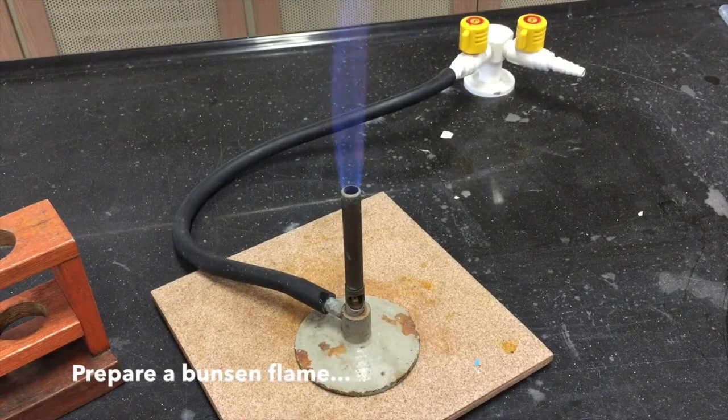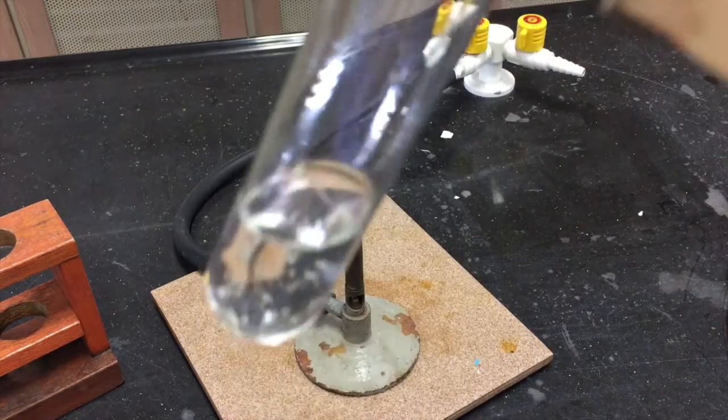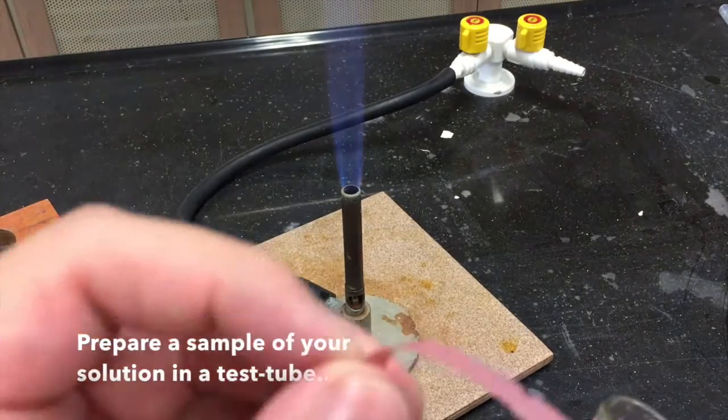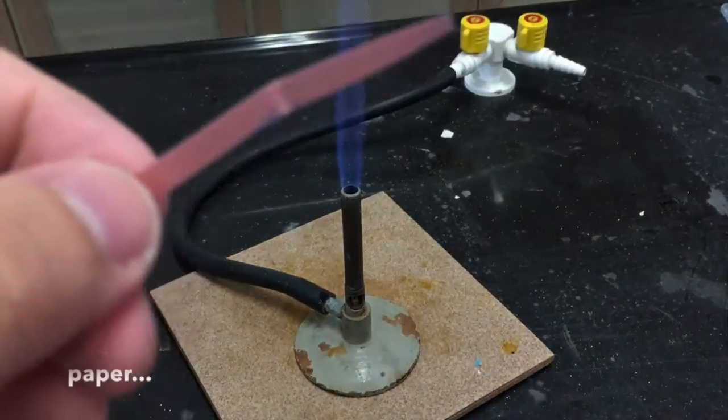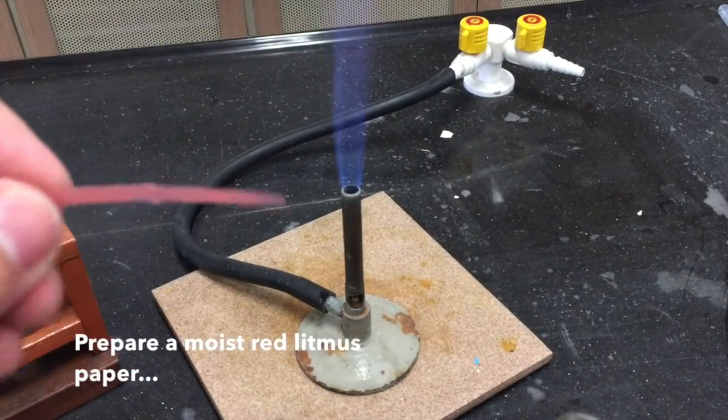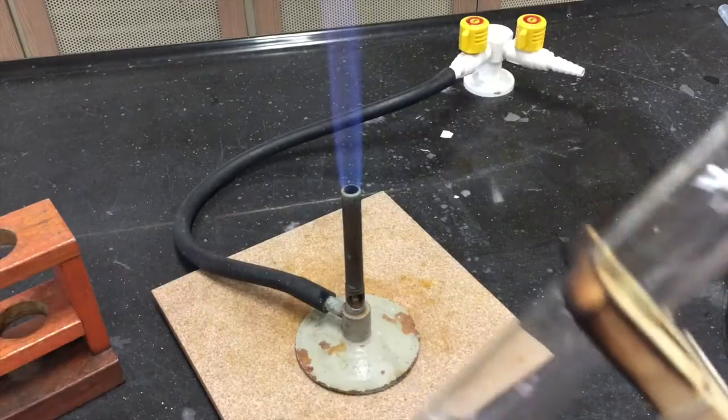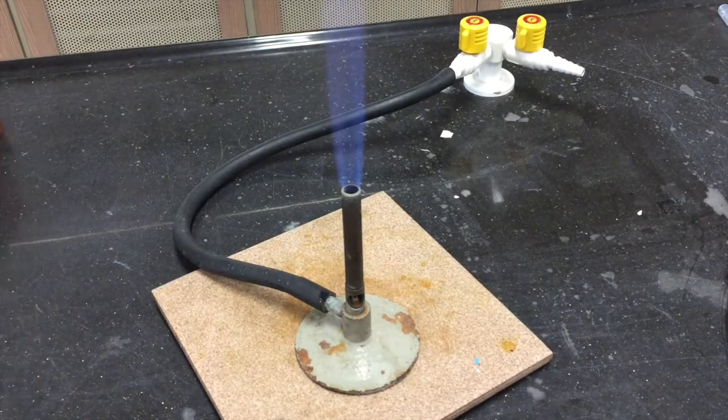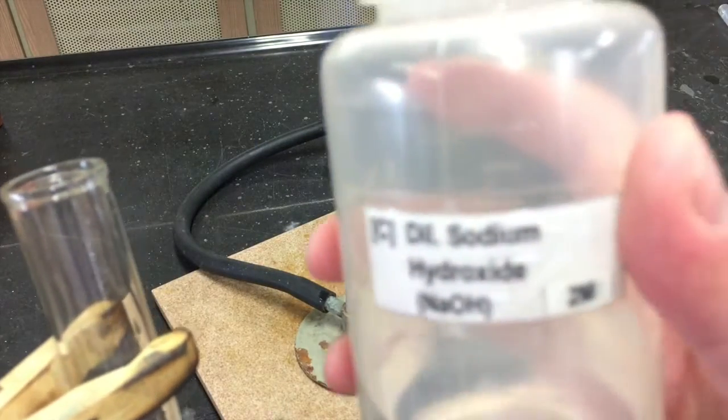For this test, it would require a Bunsen flame and a test tube to contain your solution. You will also need a moist red litmus paper. Ensure that you have everything necessary before you begin the test.